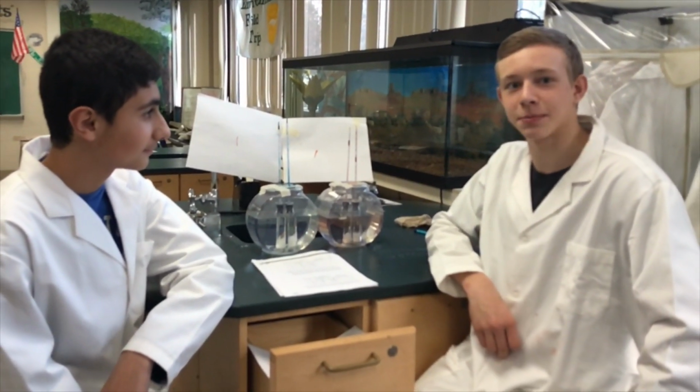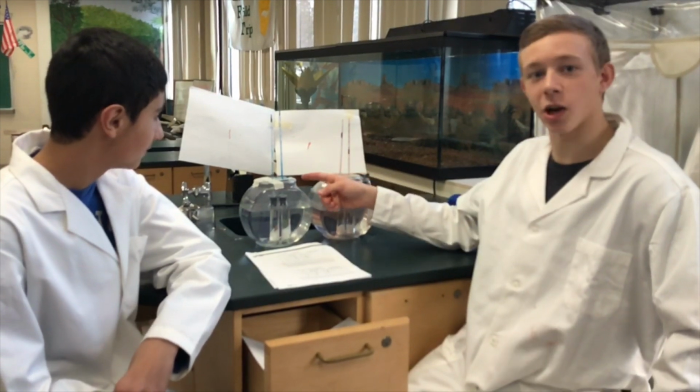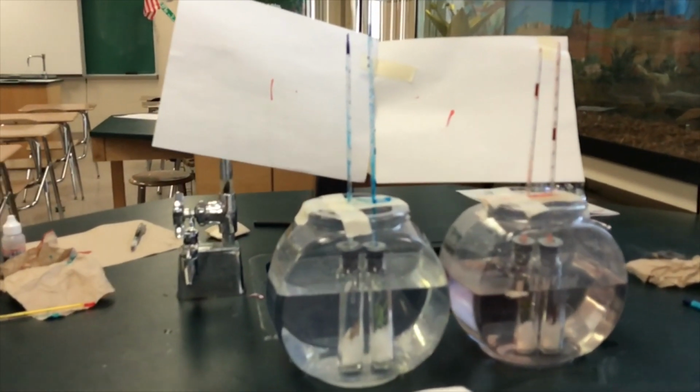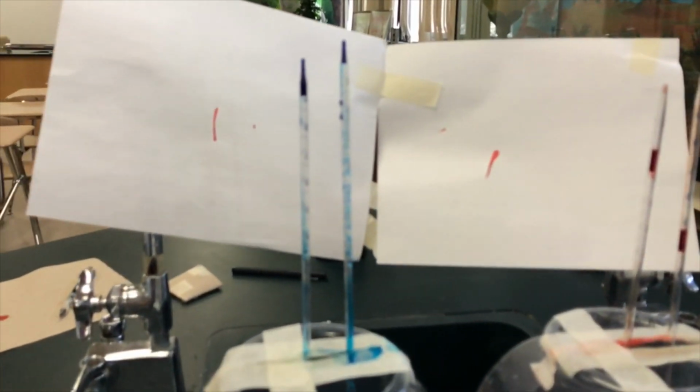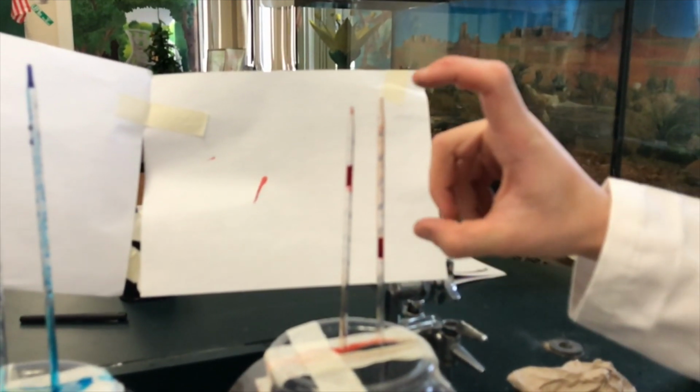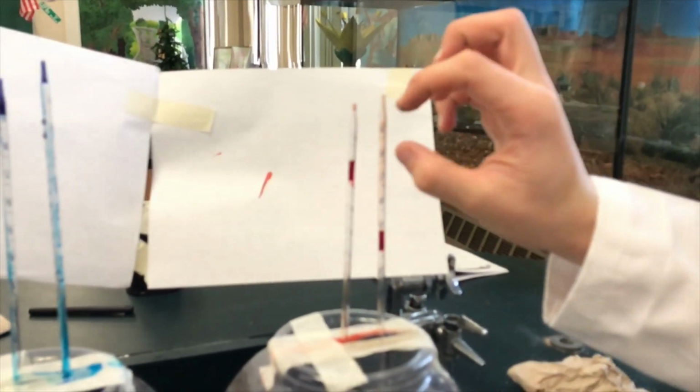We have concluded this experiment. As you can see, the cold water has gone down little to none. Probably actually none. And the non-living specimen, yep. But as you can see, the warm water has had a drastic increase. Even the non-living, the plastic cricket, has gone down.